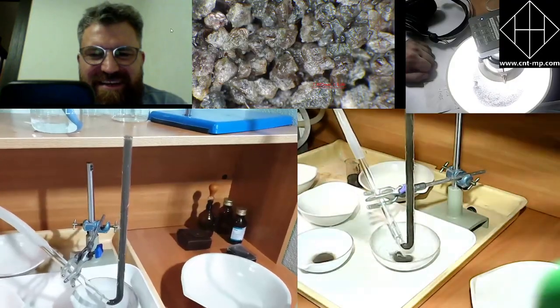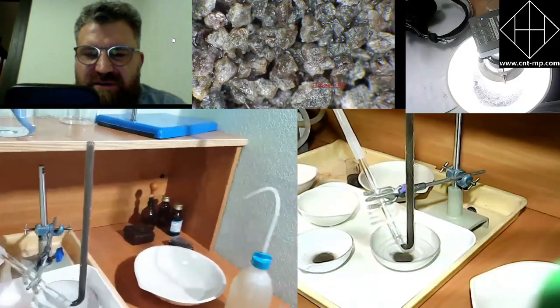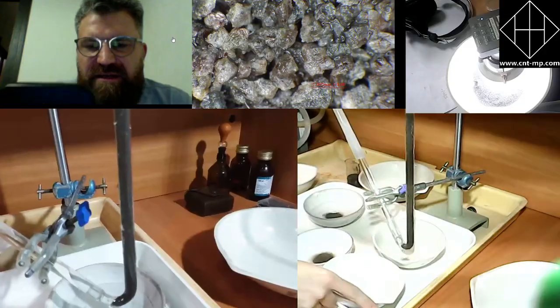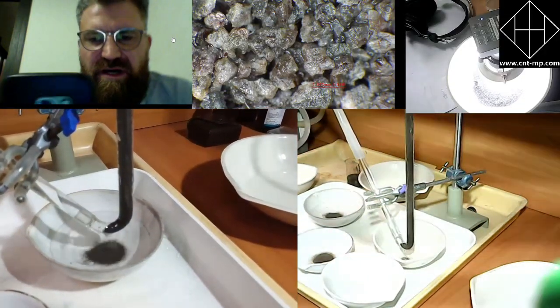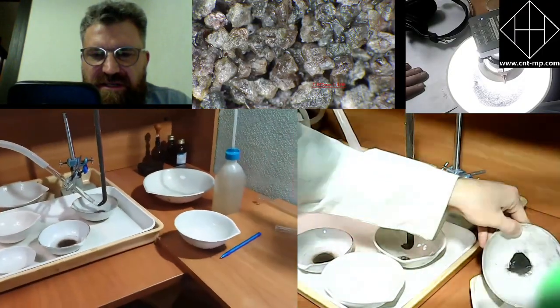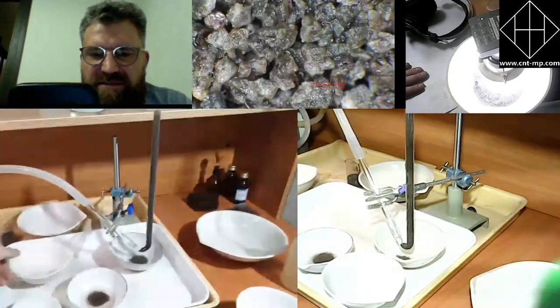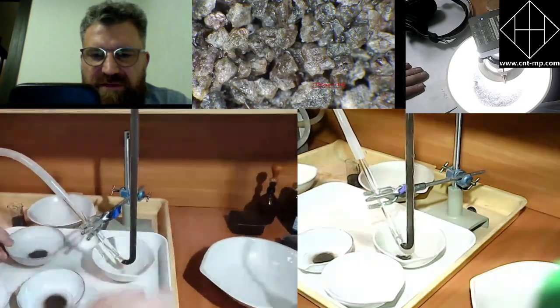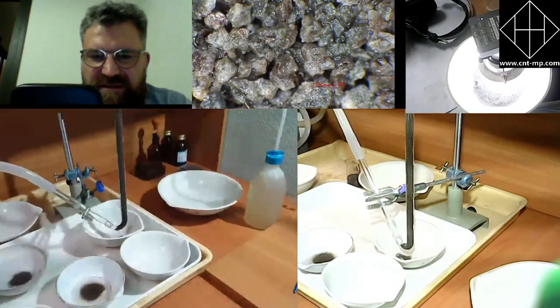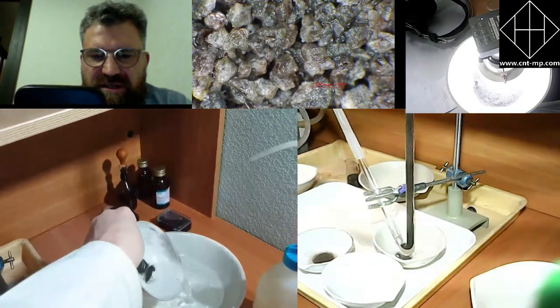You haven't seen that we actually reject all the concentrate that stays at the bottom. Can you show how to evacuate the concentrate from the GST? People would want to see that. You just have to wait a little bit until we get to the point when the final concentrate stays in the separation tube, and then they will reject that amount of concentrate to a separate dish, and then you will see this final product.